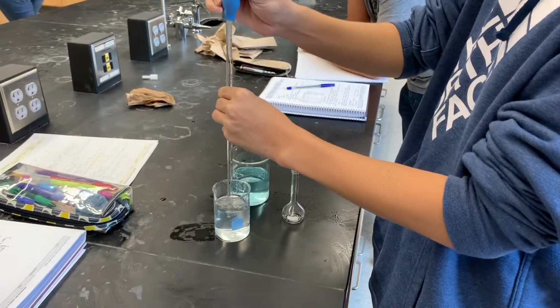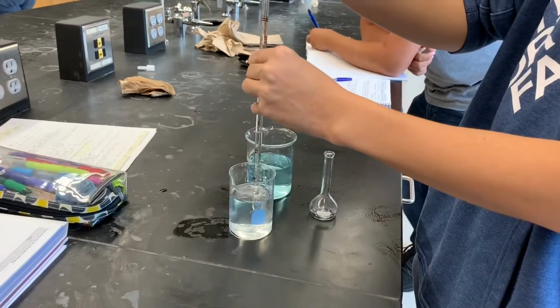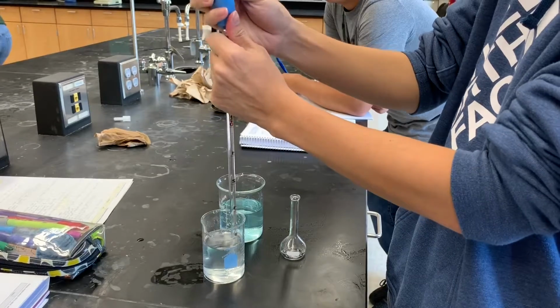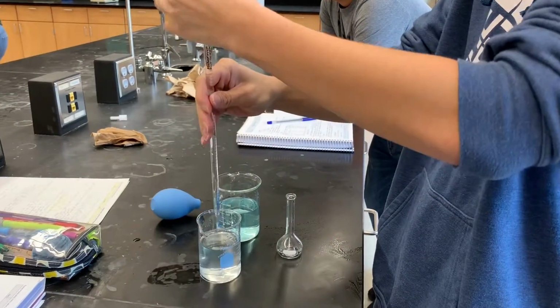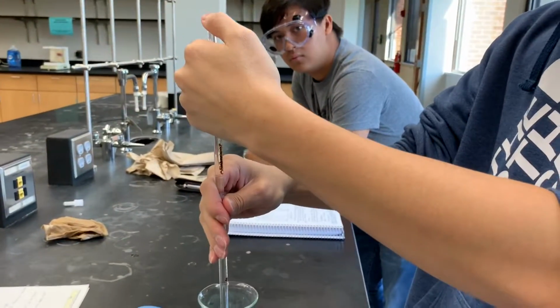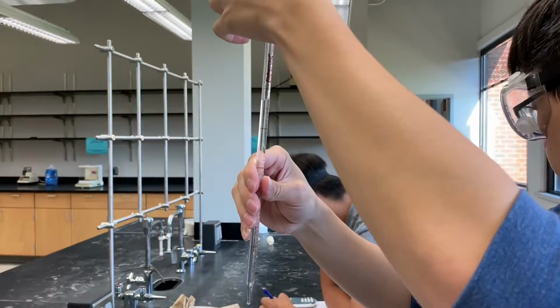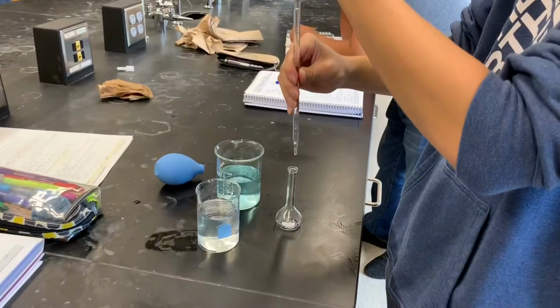To get the volume of the stock solution from a pipette, the lab member reads the initial volume of the bottom of the meniscus with a 0.01 uncertainty, and it is recorded. Then they release some of the solution into the volumetric flask before reading the final volume in the same way. To find the volume of the stock solution, the lab members will subtract the initial volume from the final volume.